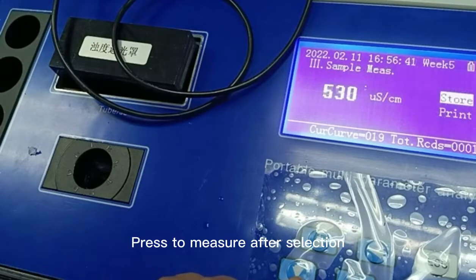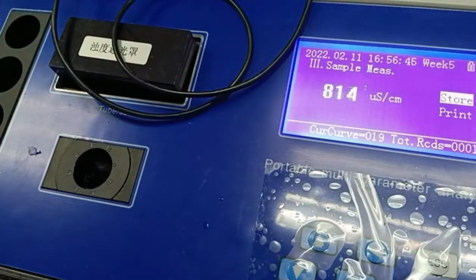Press to measure after selection. Then look at its value.